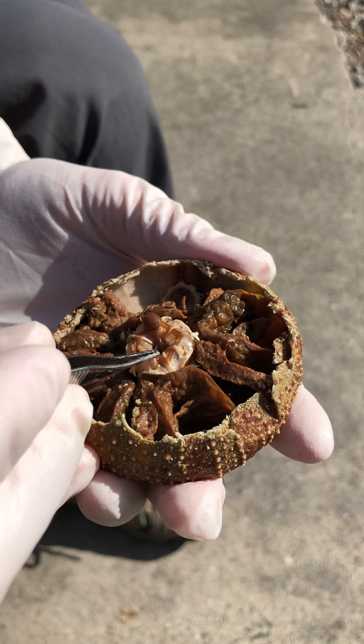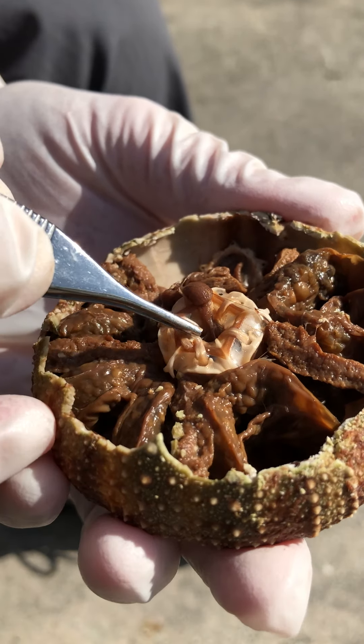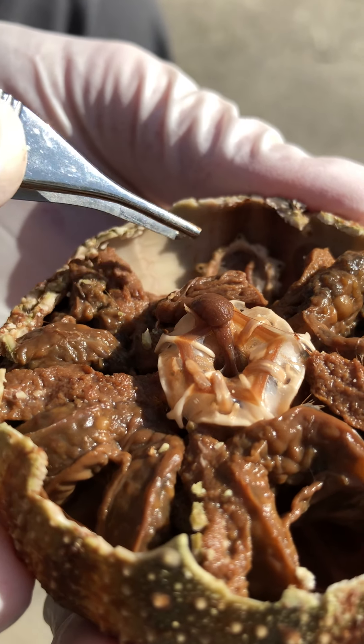Notice that if the mouth is over on the oral surface, then this tube coming up here must be from the mouth, which makes it the esophagus. And then it expands right here — this is the stomach.